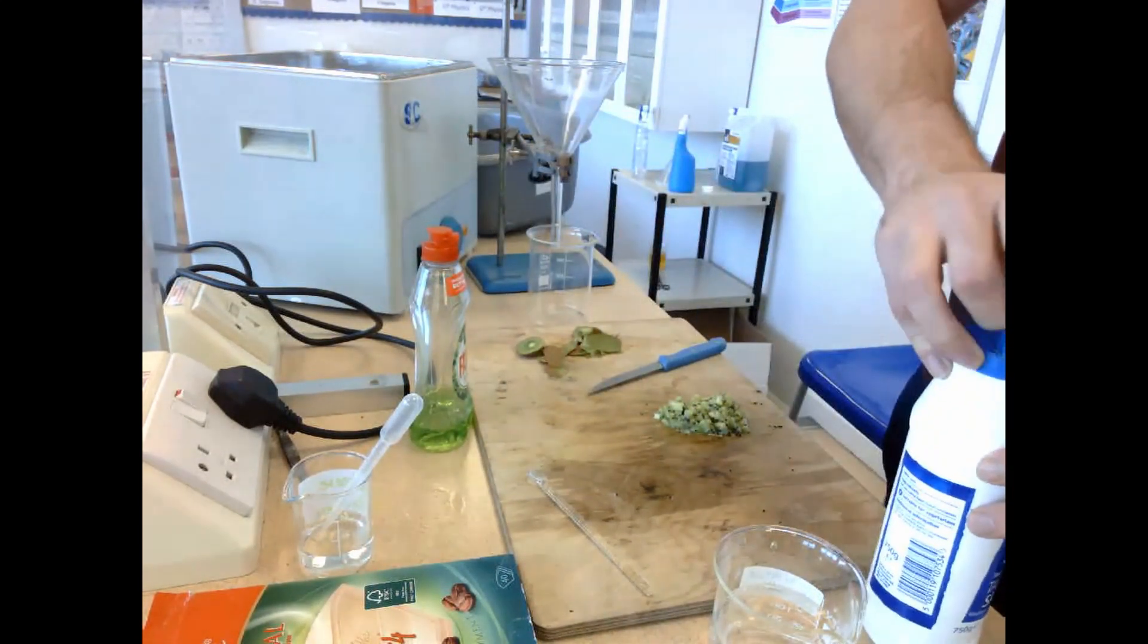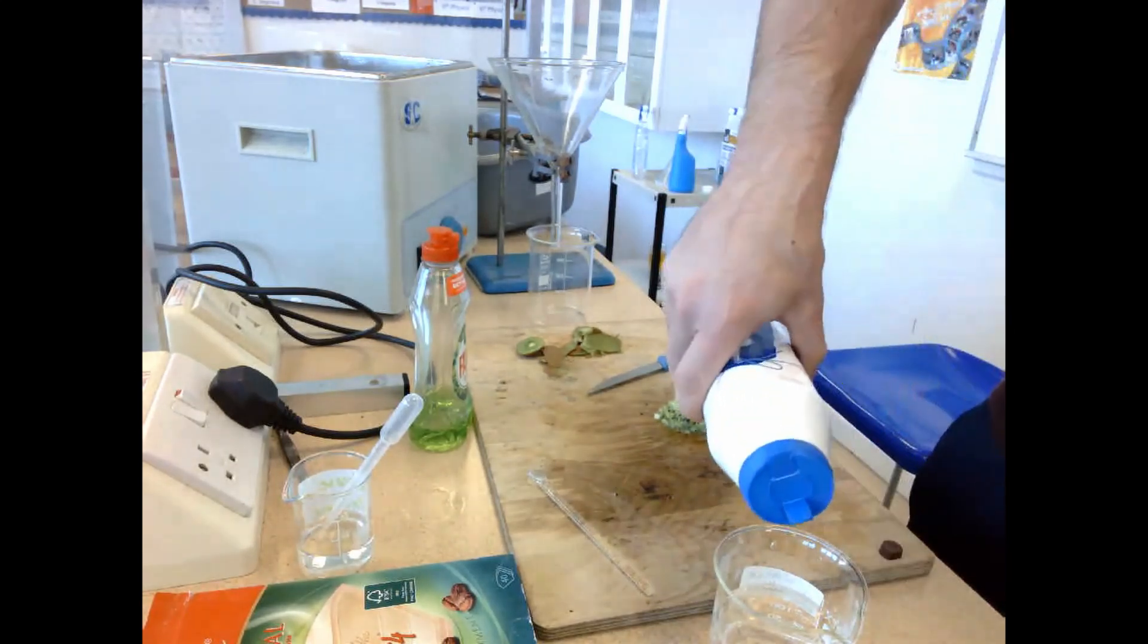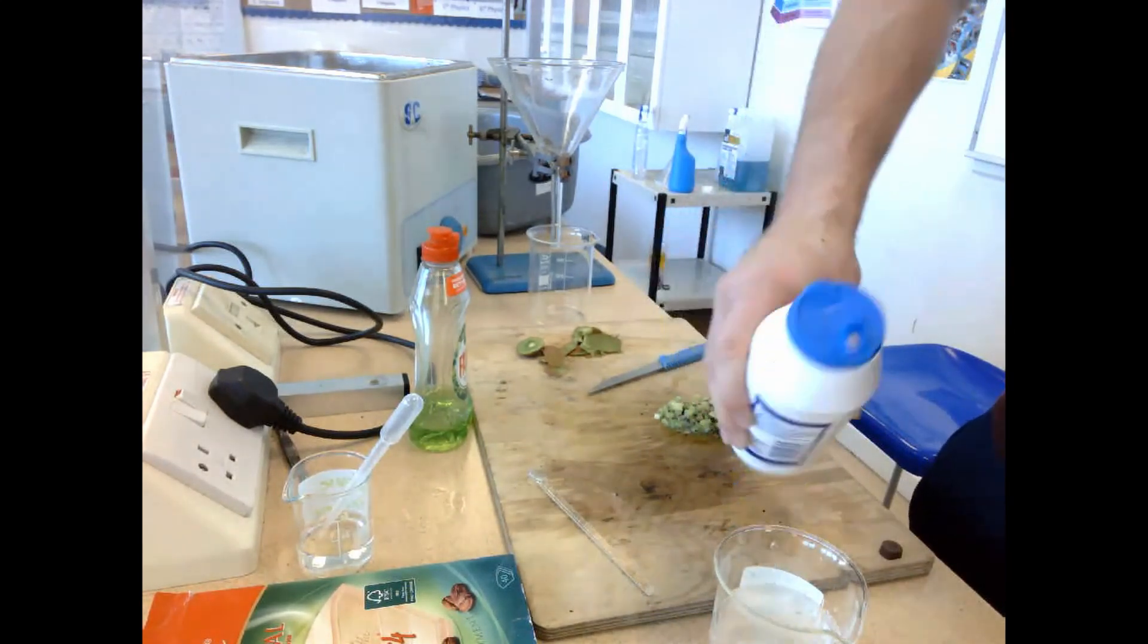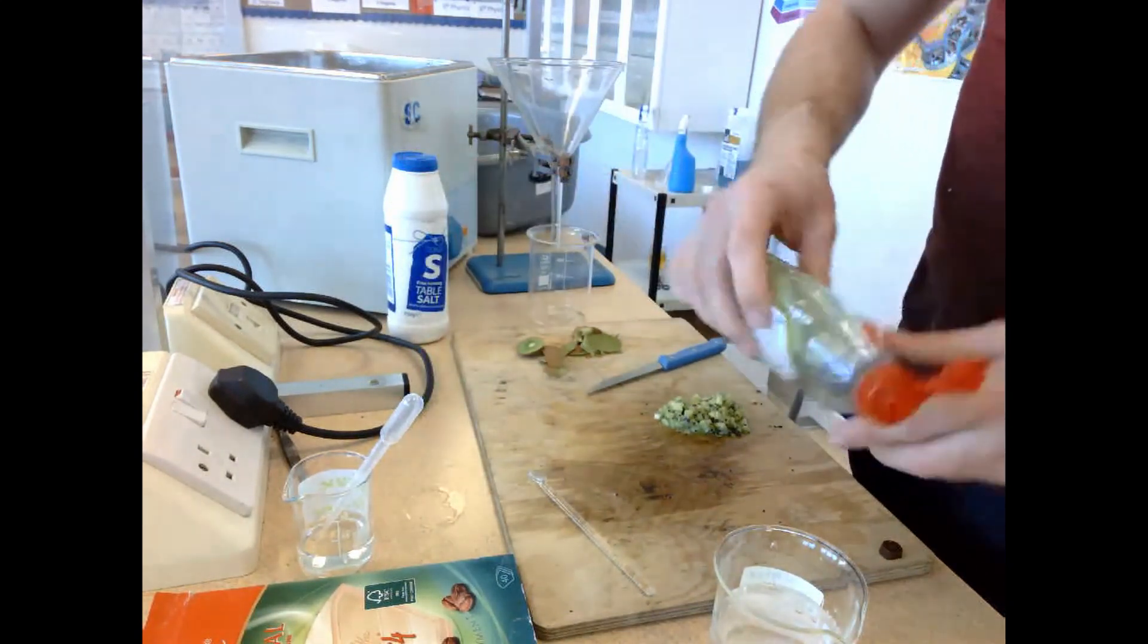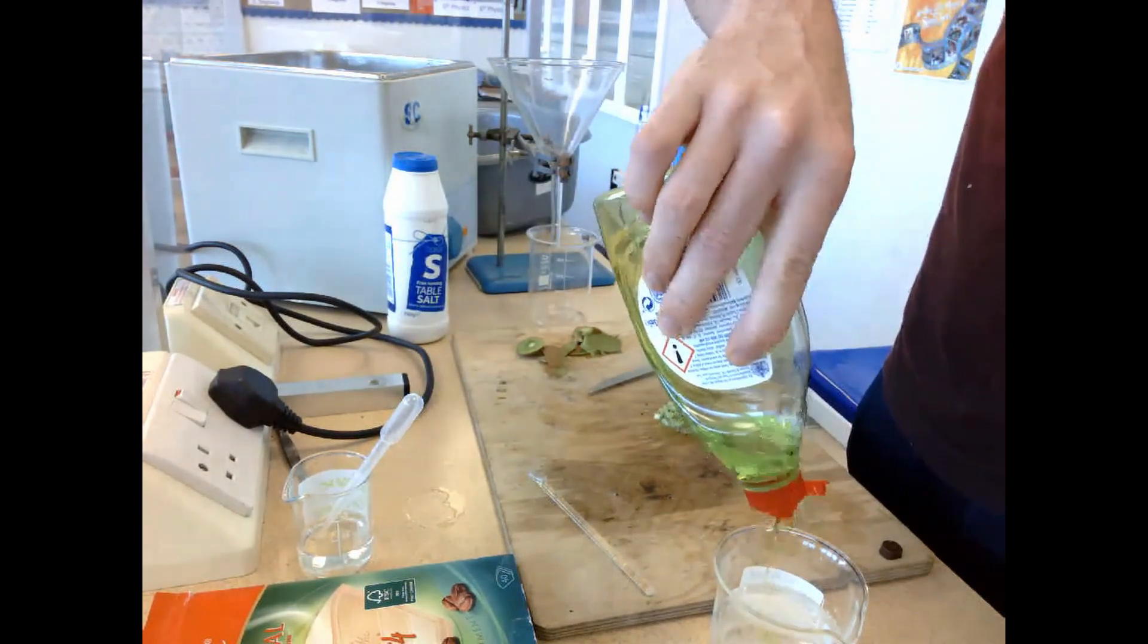Once the salt's in there, we take some washing up liquid and add that to the water solution as well, because the washing up liquid will be there to disrupt and break down cell membranes because of the phospholipids that will be in the cell membranes.